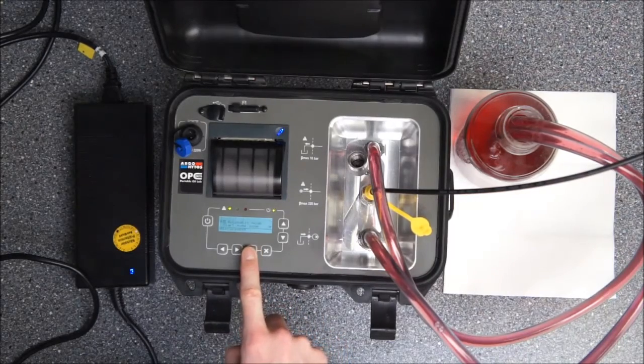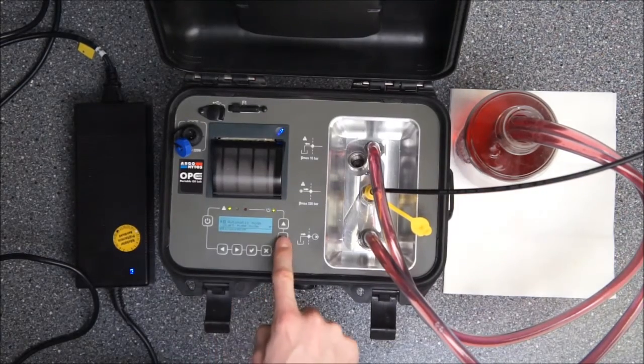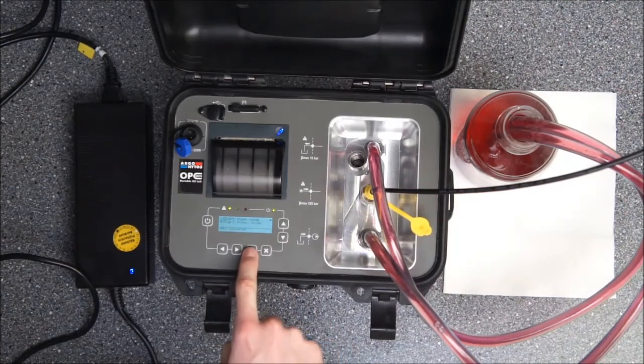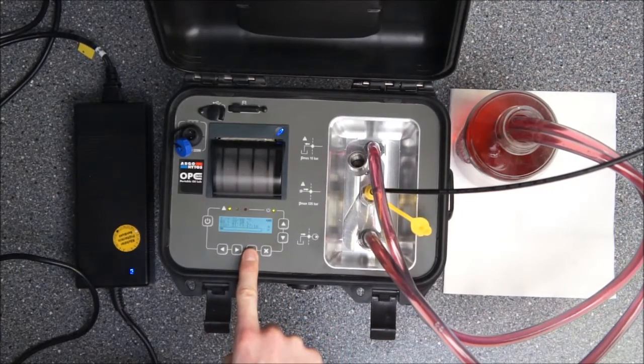And I will choose this time also the automatic mode but not the pump. I will choose from the pressure mode and just activate pressure mode.